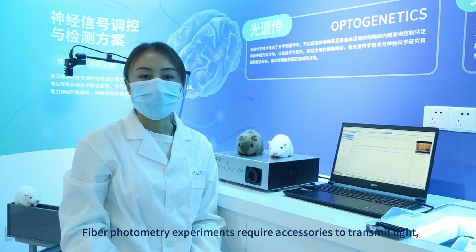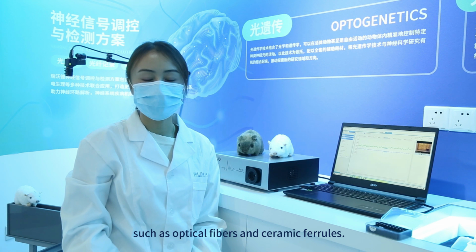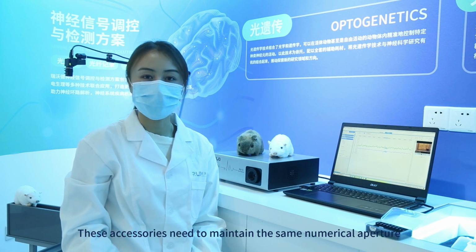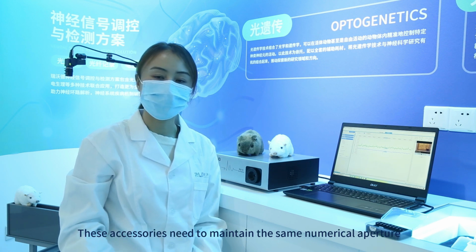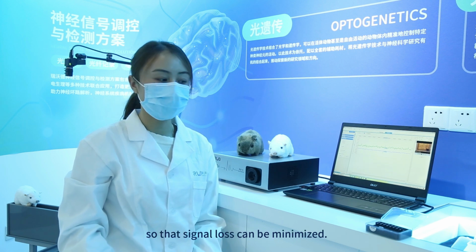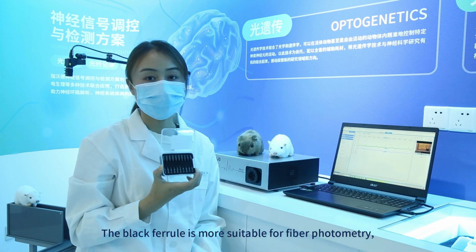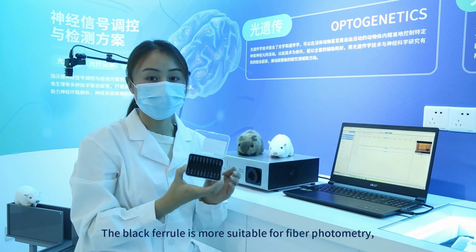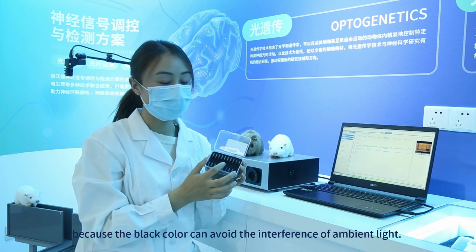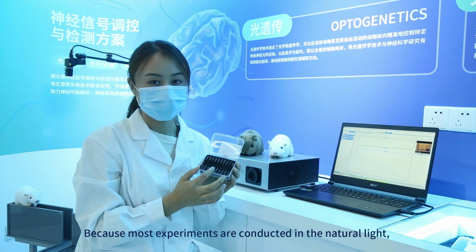Fiber photometry experiments require accessories to transmit light, such as optical fibers and ceramic ferrules. These accessories need to maintain the same numerical aperture so that signal loss can be minimized. The black ferrule is more suitable for fiber photometry because the black color can avoid the interference of ambient light.